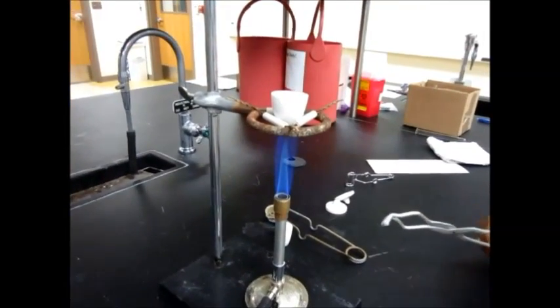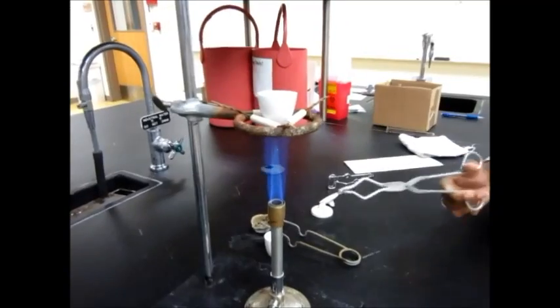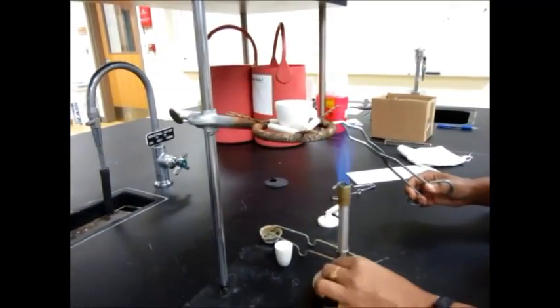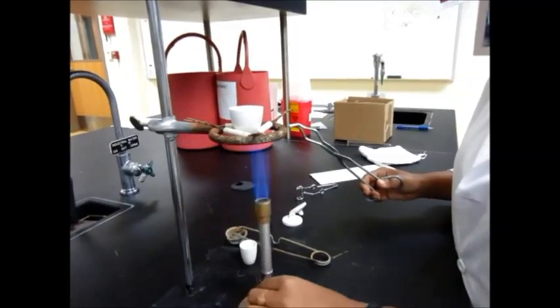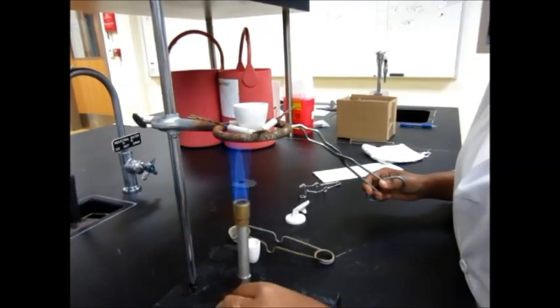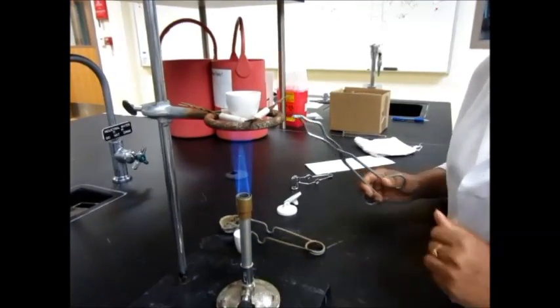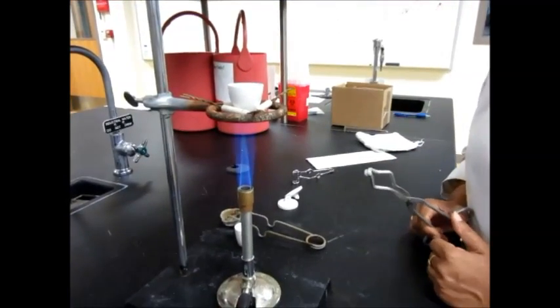In some cases, you may need to move your Bunsen burner around in order to periodically heat the crucible. But in the experiments you're doing here in our Gen Chem labs, you will have to heat that continuously like this.